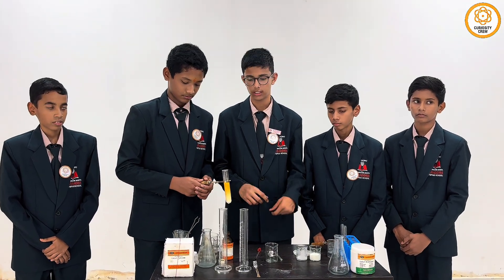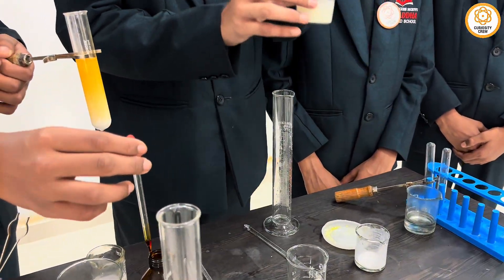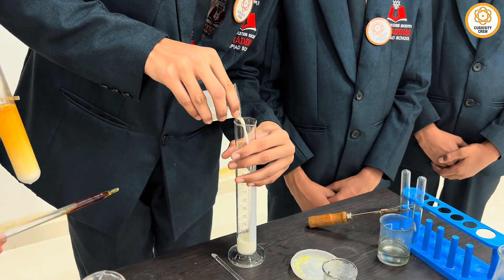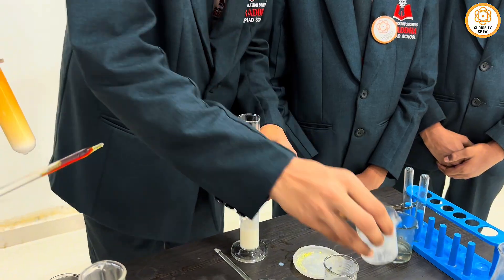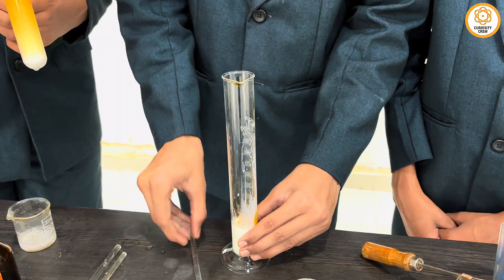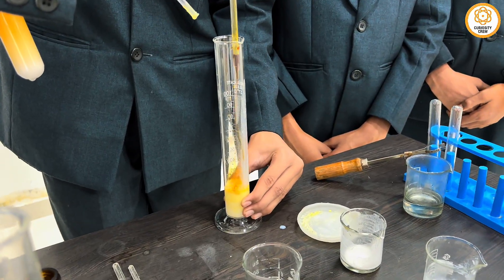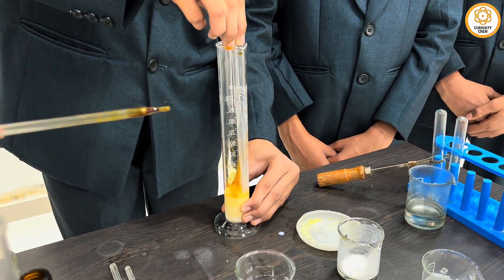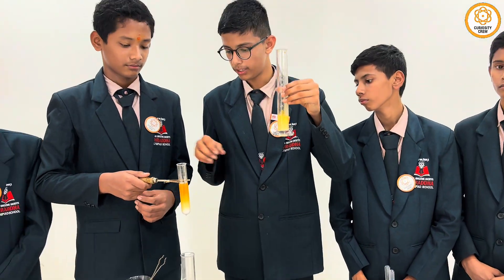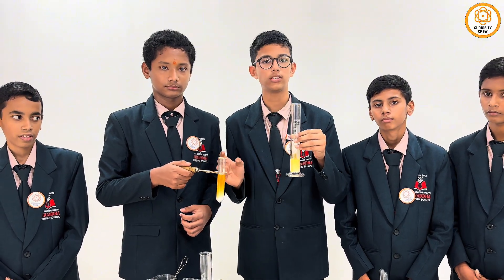Now we will test iodine in natural milk. This is natural milk. We will add iodine into the natural milk. The solution turns yellowish, whereas the synthetic milk turned brownish. Therefore, this is the difference between natural milk and synthetic milk.